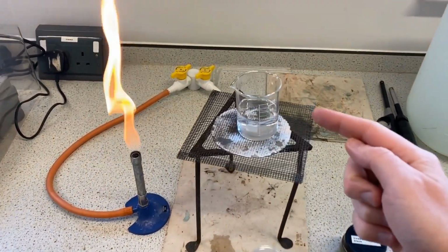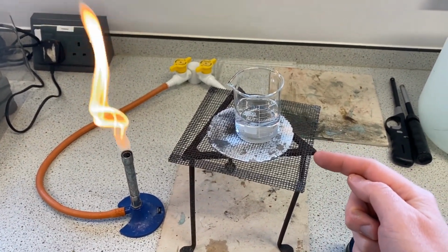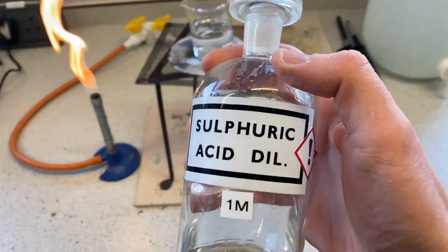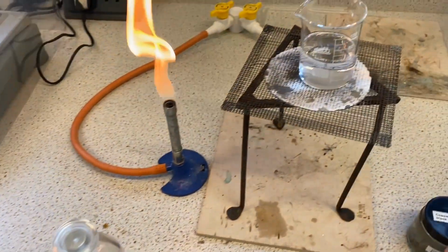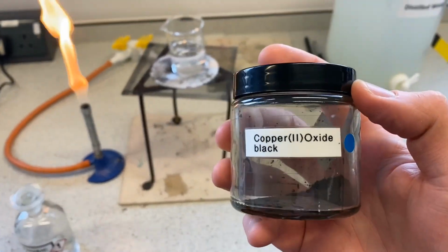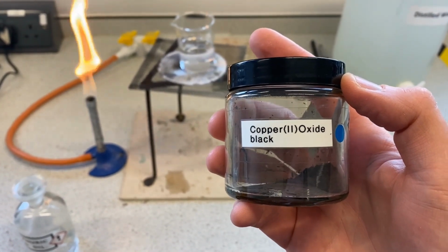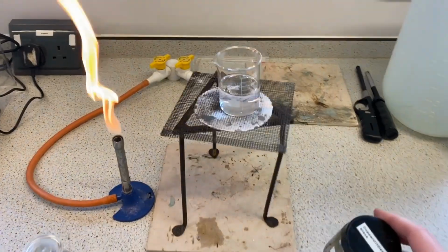We've got some sulfuric acid here in this beaker, which is on a tripod and a gauze. So I'm using 1 molar, 1 mole per decimeter cubed of sulfuric acid. And to it, we're going to add copper oxide. So this is a simple acid-base reaction. Sulfuric acid and copper oxide makes copper sulfate and water.